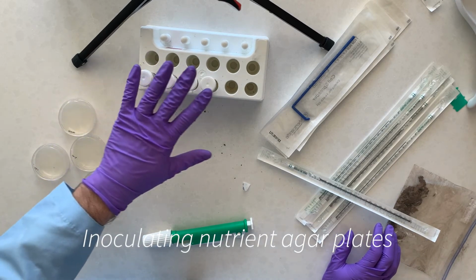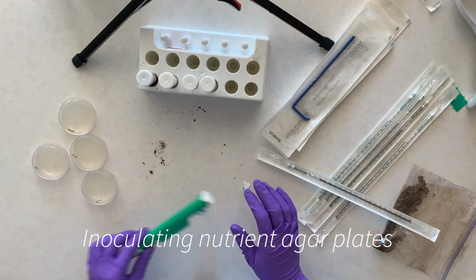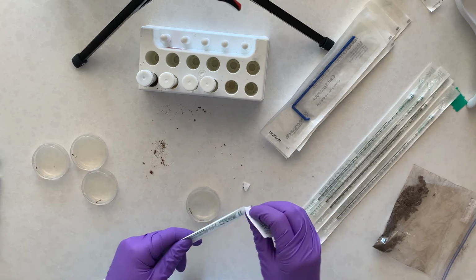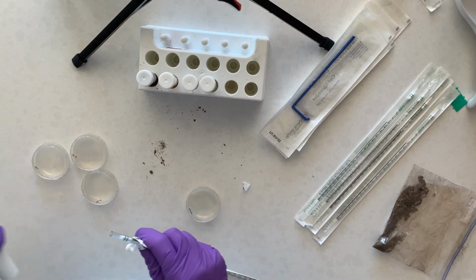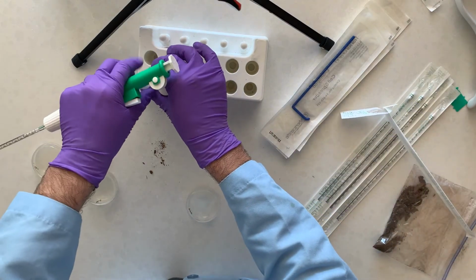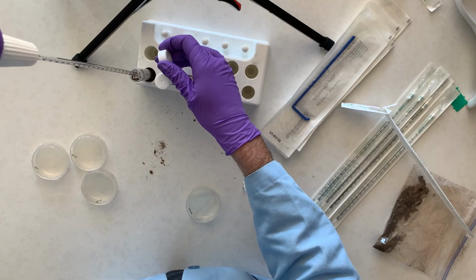Make sure that you're just matching the tubes to the plates, okay? So that's what we're going to do. So I'm going to take my first plate and add the volume as indicated, so 0.1 milliliter. So this first one is the stock. So I'm going to drop some of that.